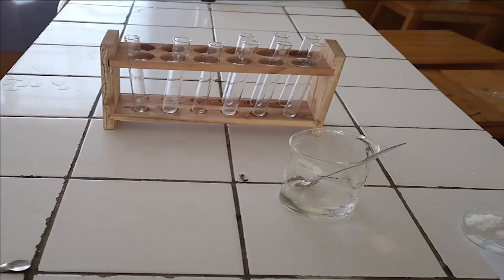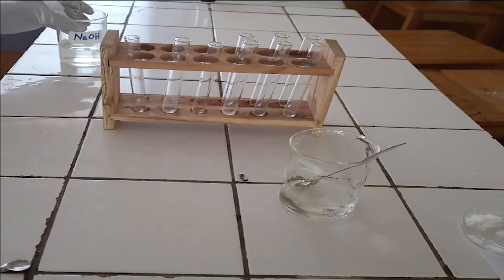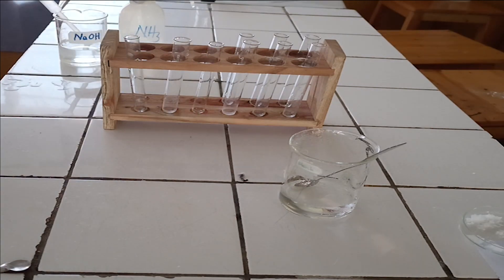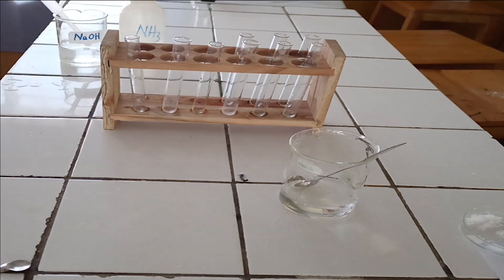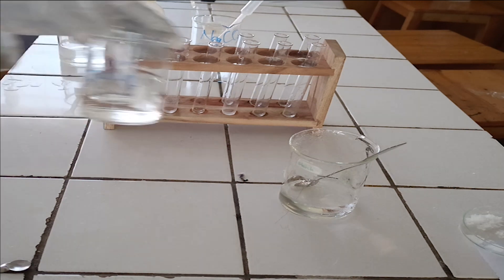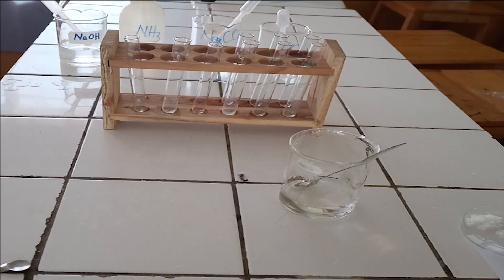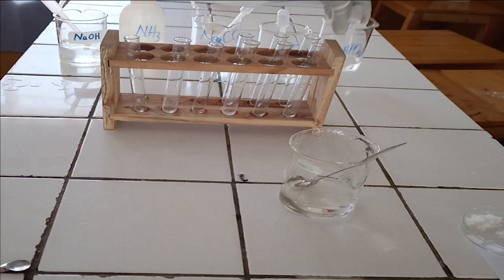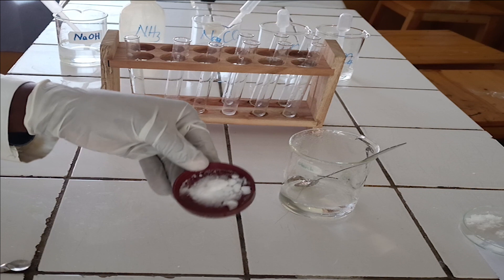Chemicals required: 1. Sodium hydroxide solution. 2. Diluted ammonia. 3. Sodium carbonate solution. 4. Diluted sulfuric acid. 5. Disodium hydrogen phosphate. 6. Ammonium chloride solid.